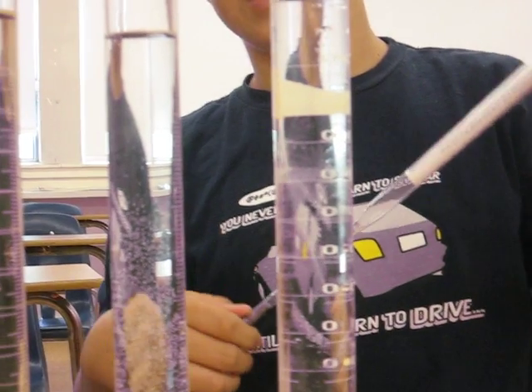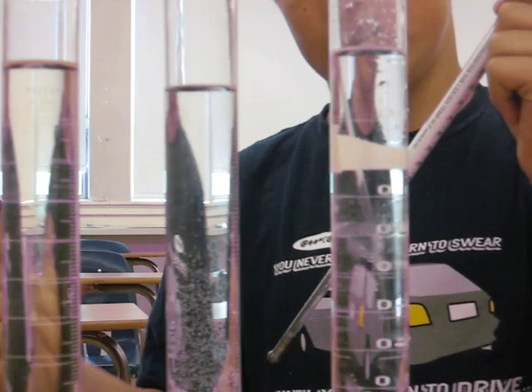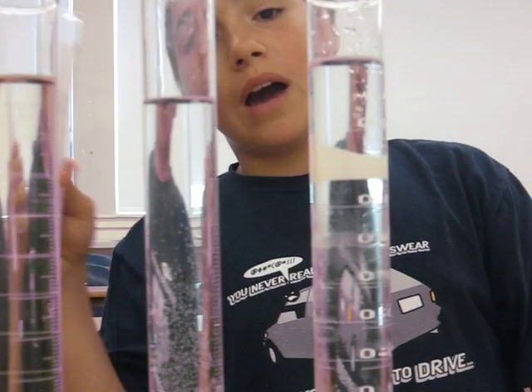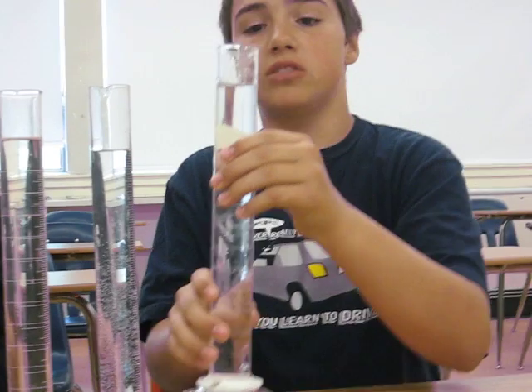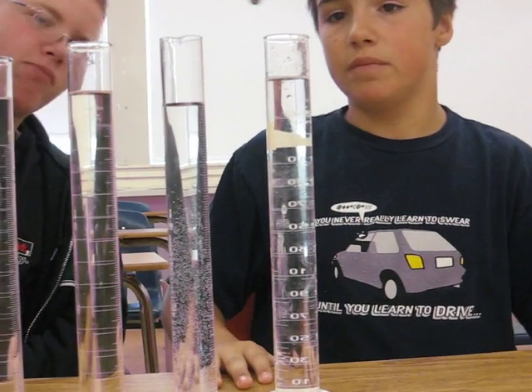As you've seen, it was at 1. Now we're going to try glycerol, as Eric here says, and I'm going to let Eric drop it in. I want to point out this is very thick — look at that. It's like hair gel. If I really wanted to, I could probably gel my hair back like Elvis Presley. So Eric, can you drop that in?